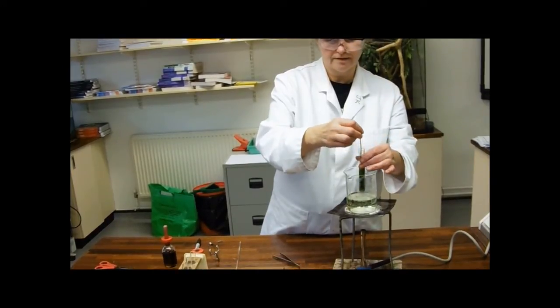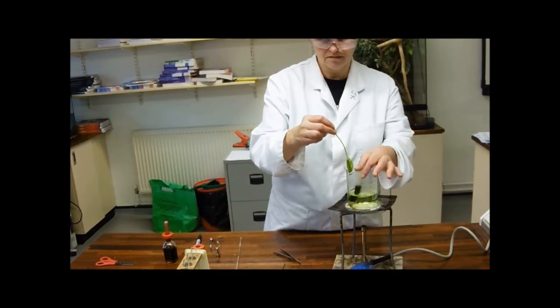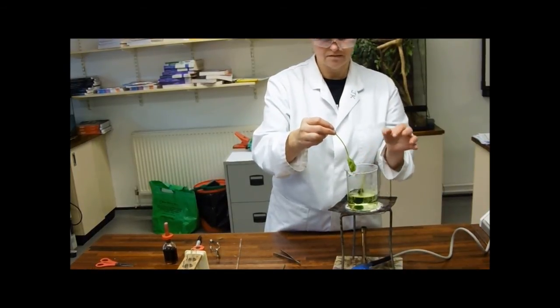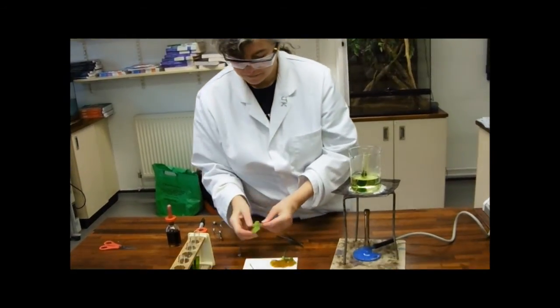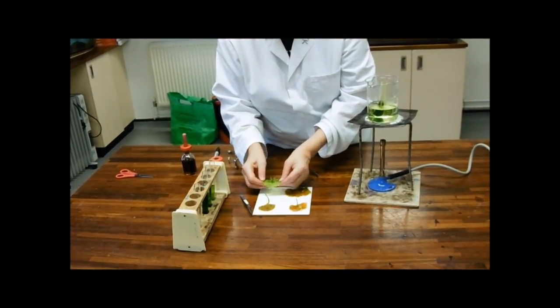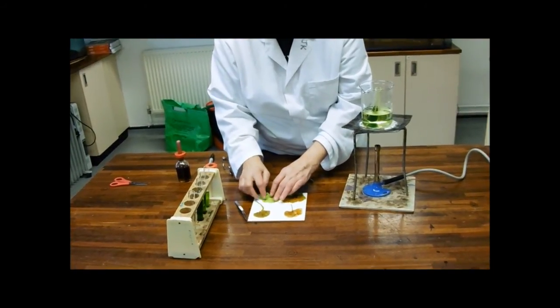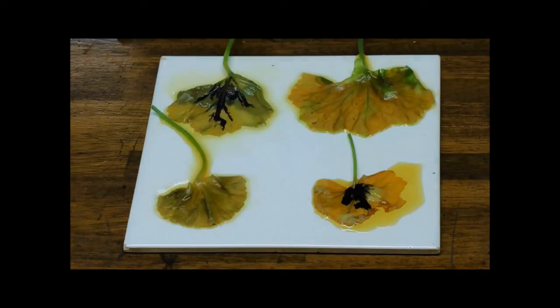And finally, this is the one with the lovely star cut out of it. I'm really looking for this one because it's a lovely, lovely, lovely blue black color.